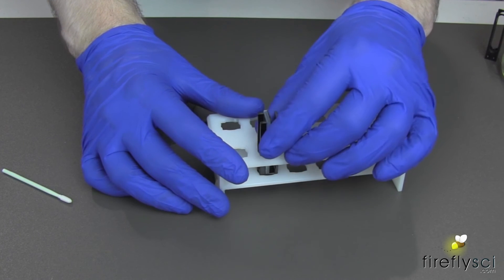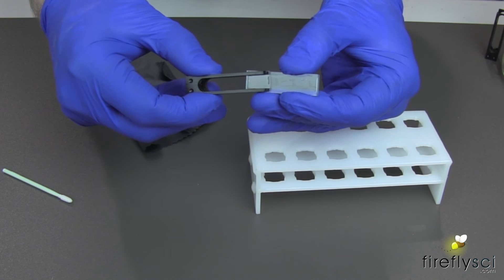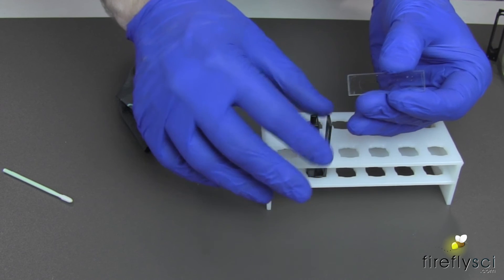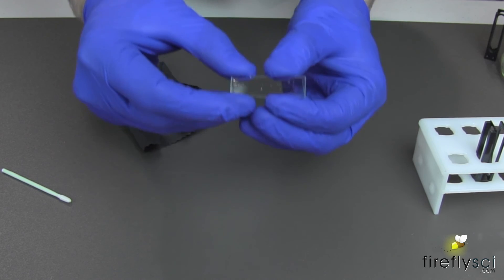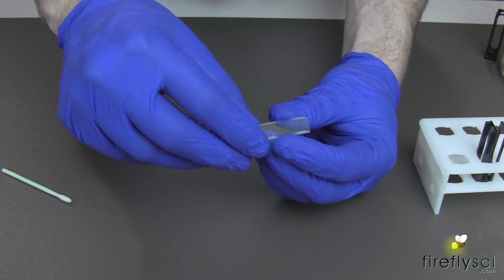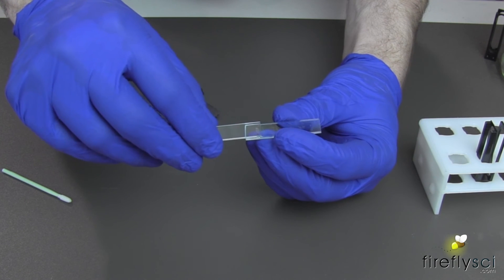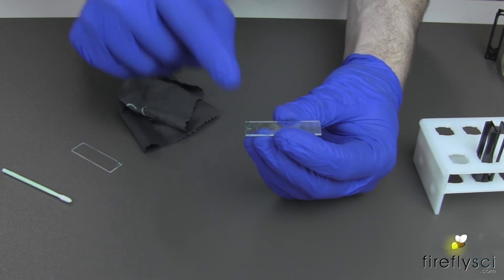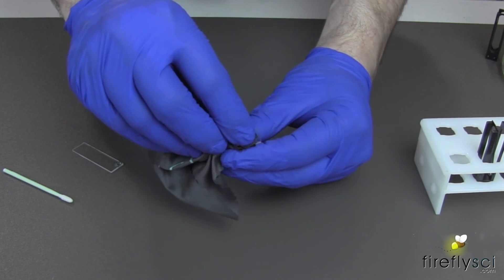To disassemble the Type 19 cell, first we'll have to take it out of the cell mount — just simply slide it right out just like this, and hear the spring snap into place. We'll put that to the side. Now we'll want to make sure that the groove plate is down, and we disassemble it just like the Type 20. We simply slide the cover plate right off, nice and slow, so we don't make a mess. We'll end up with that drop right on the end again.